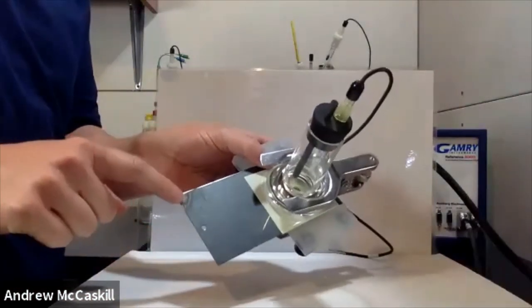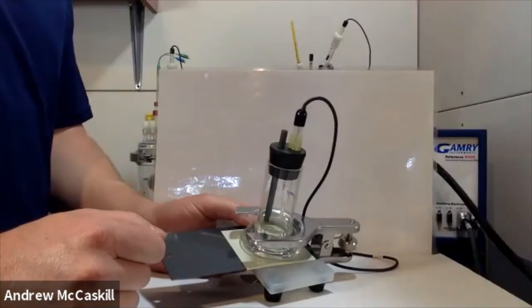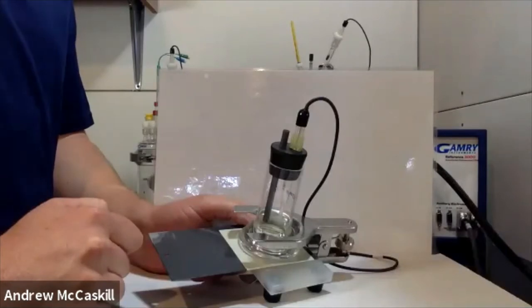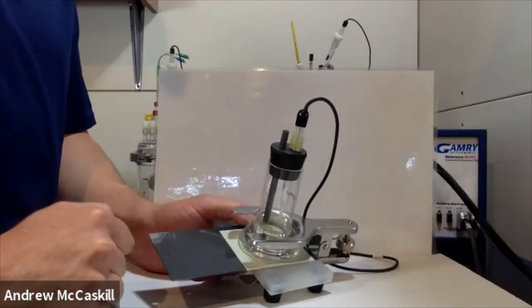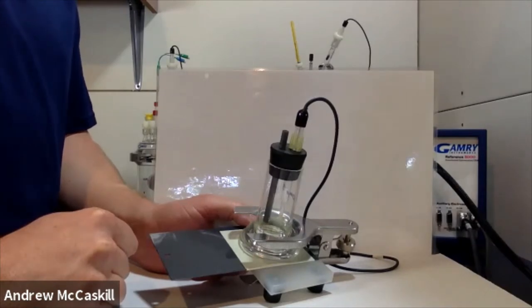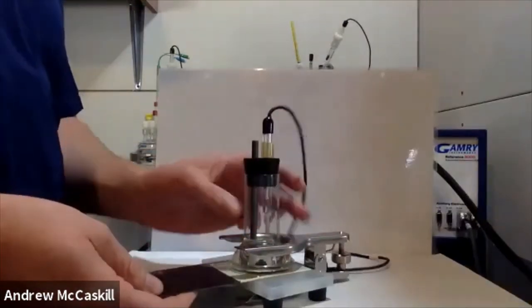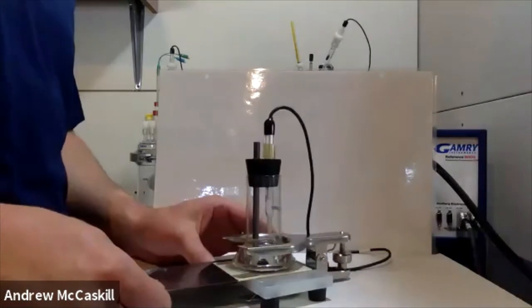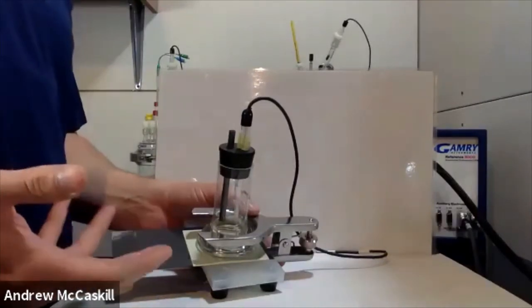Running electrochemical experiments on coated samples can be a fast and effective way to characterize the coating, as opposed to doing long exposure experiments and just doing a weight loss or visually inspecting the coating after weeks of testing. This is a faster way to test coatings. This is a basic three-electrode cell — you're probably going to hear me say 'three electrode' many times. All of these cells essentially support a three-electrode experiment; they're just designed a little bit differently to support different samples.